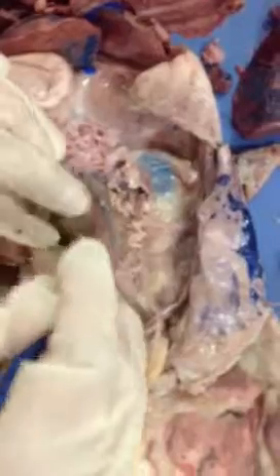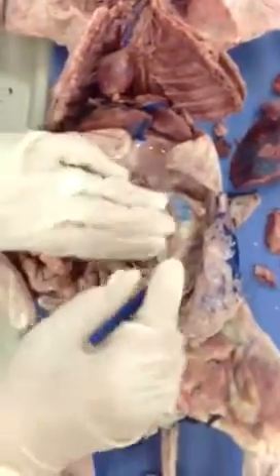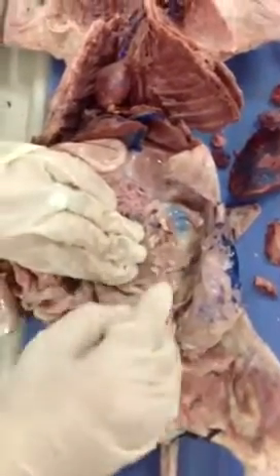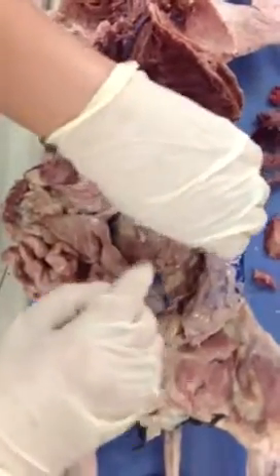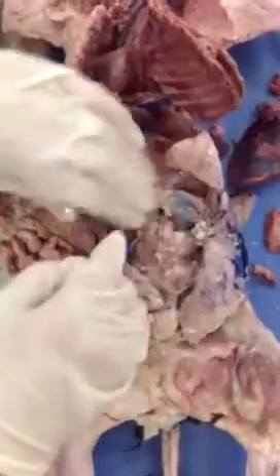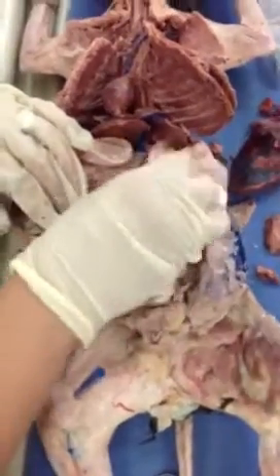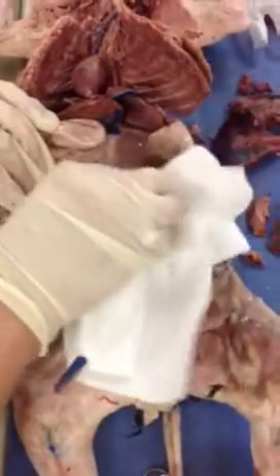Now, the next branch, please. Renal. So by its name, you could tell that it's going where? Kidney. Exactly. So these are our kidneys, right? I'm going to separate all this adipose tissue, connective tissue that we see here, so we can see the blood vessels better.